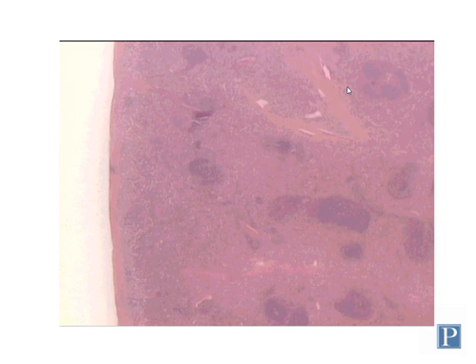This is a section of spleen, and spleen is probably one of the hardest organs to understand histologically because it has a fairly complex structure. So I would certainly encourage everyone to read the chapter on lymphoid tissue in their basic histology text and pay special attention to spleen, because there's some really nice diagrams in that section that do a good job of explaining histology.